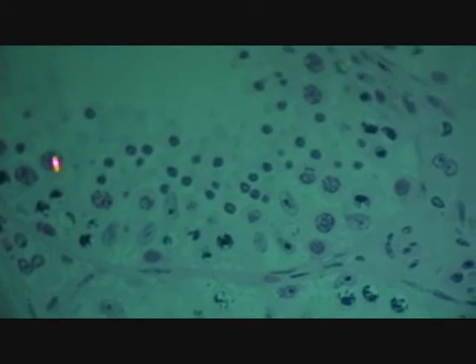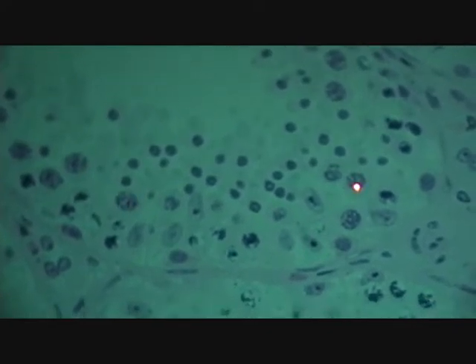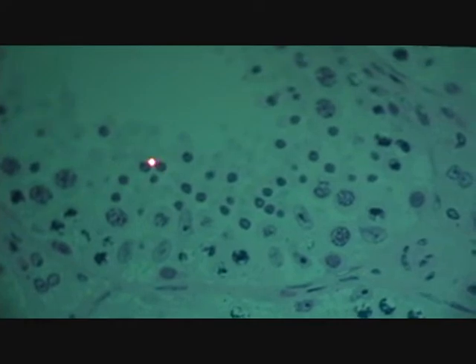Those are spermatocytes. I only care that you identify them as spermatocytes. Don't worry about them being primary or secondary. But what you're doing here genetically is preparing them for meiosis. Reductional division so that this and this becomes this. Much smaller nucleus. These are the spermatids. The tids.